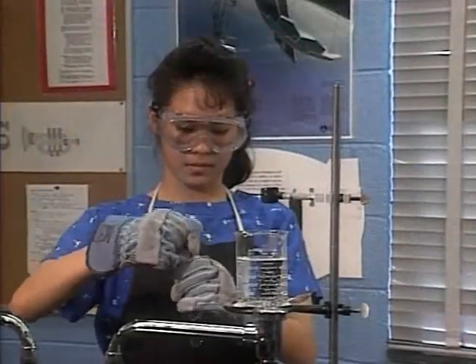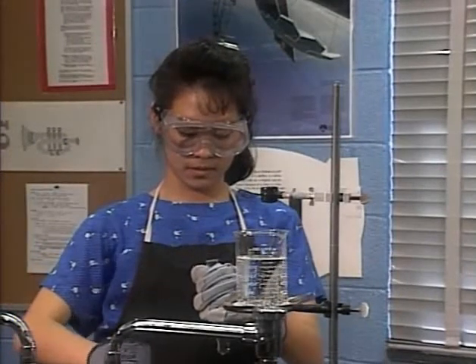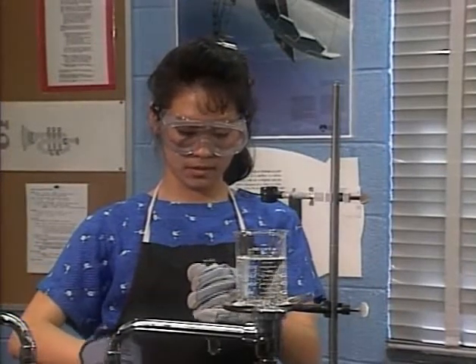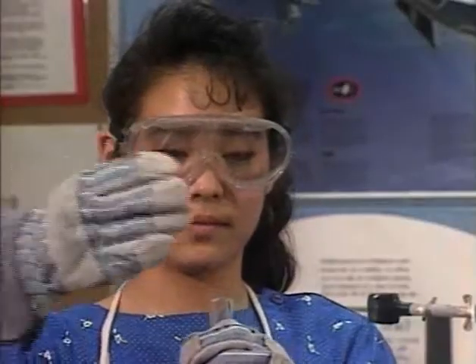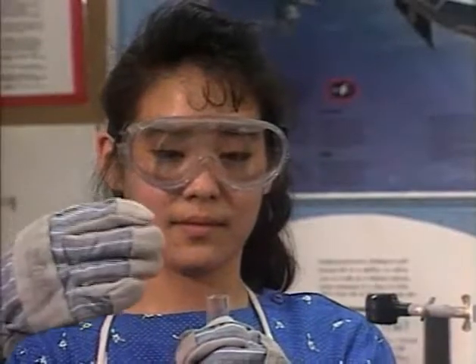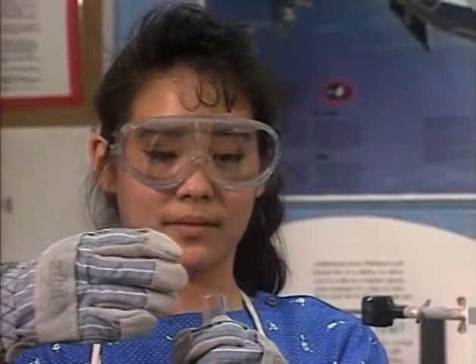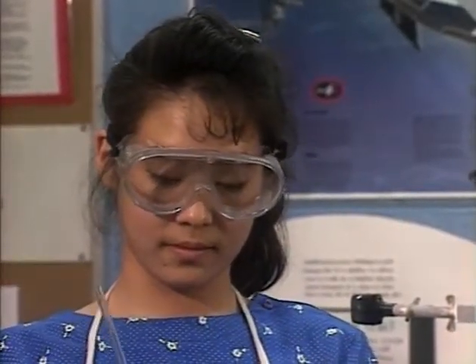There's a safe way to smell a chemical indirectly if your teacher gives you permission. Hold it away from your face and waft the vapors to your nose — that way you won't get a strong whiff of them directly.